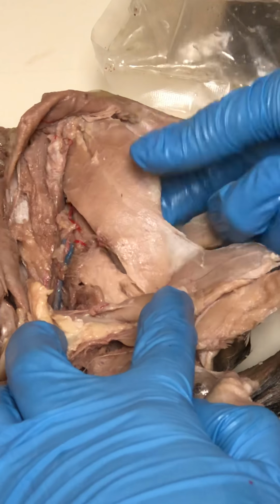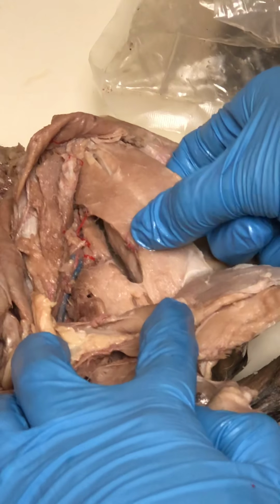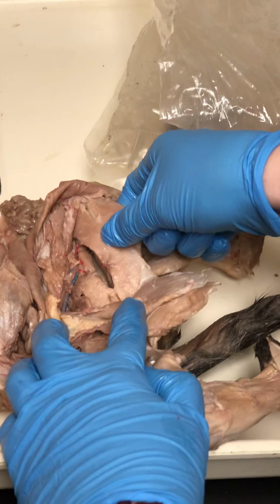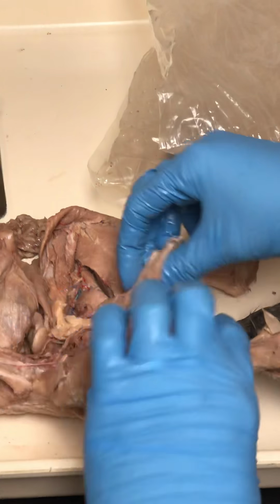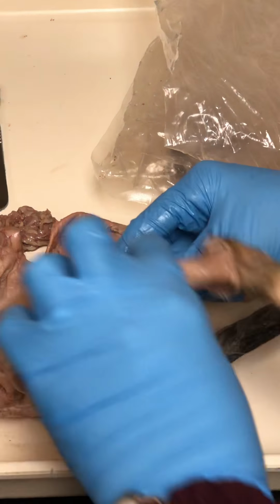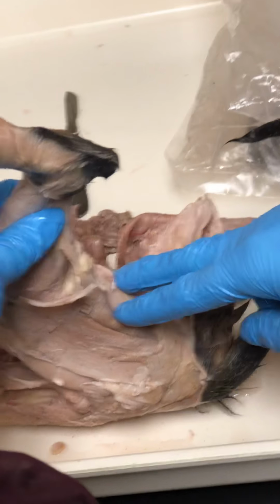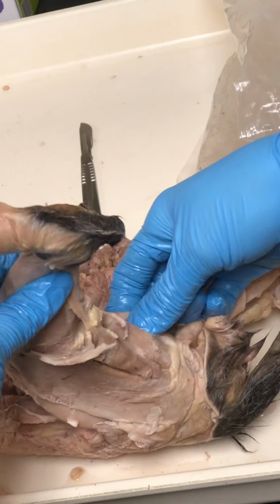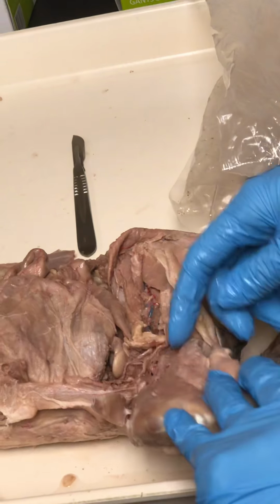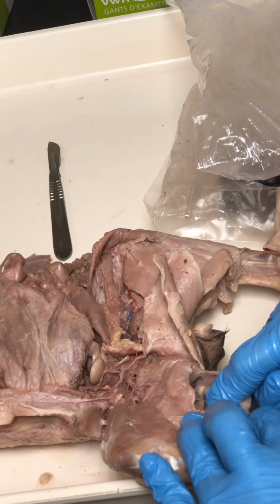Semimembranosus is this muscle here. This big one, which really is one of our hamstring muscles for us. So here's the semimembranosus, like that, on both sides. If you look at the cat from the posterior side of the thigh, like you would with us, you would see the semimembranosus being in that place of the hamstrings. Okay. And then below that is your semitendinosus.